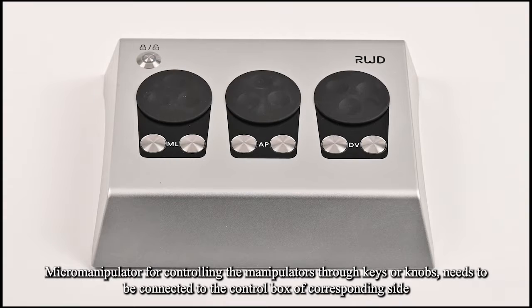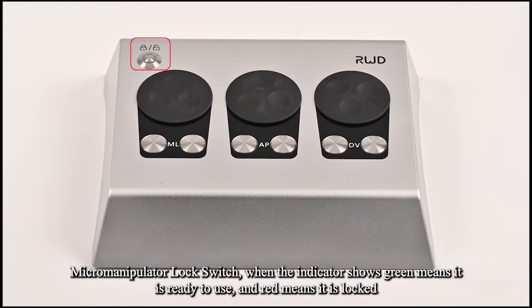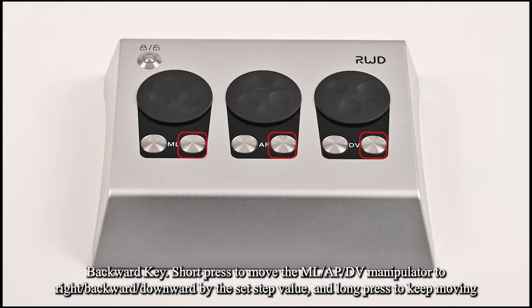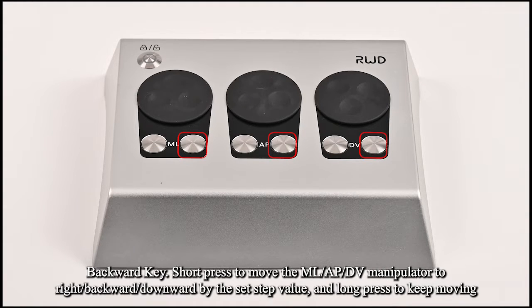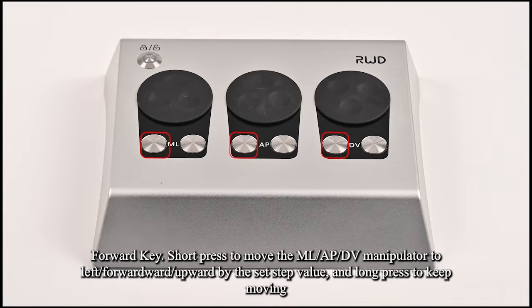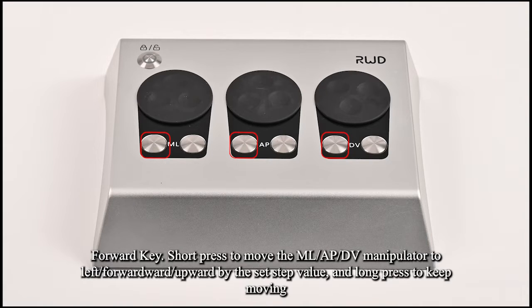The micromanipulator controls the manipulators through keys or knobs, and needs to be connected to the control box of the corresponding side. The micromanipulator lock switch indicator shows green when ready to use, and red when locked. The backward key: short press moves the ML, AP, DV manipulator to the right, backward, or downward by the set step value; long press keeps moving. The forward key: short press moves the ML, AP, DV manipulator to the left, forward, or upward by the set step value; long press keeps moving.